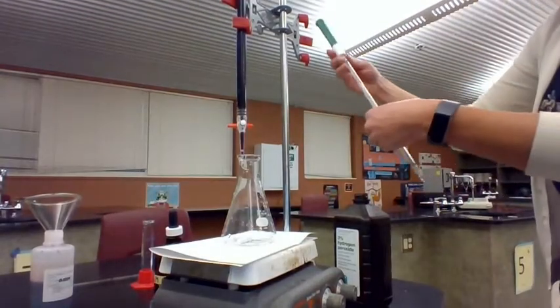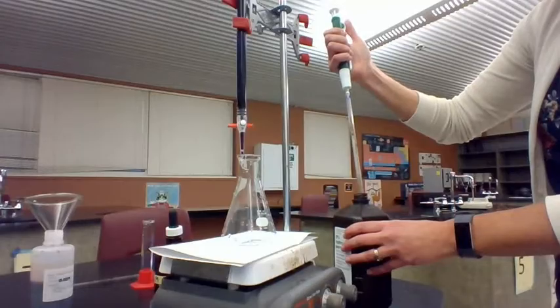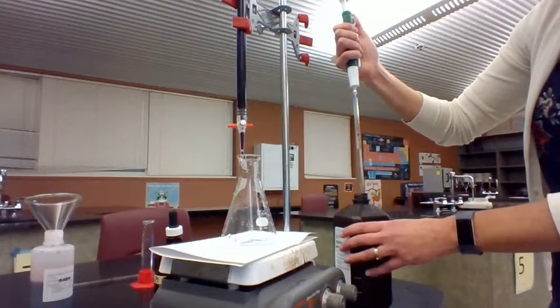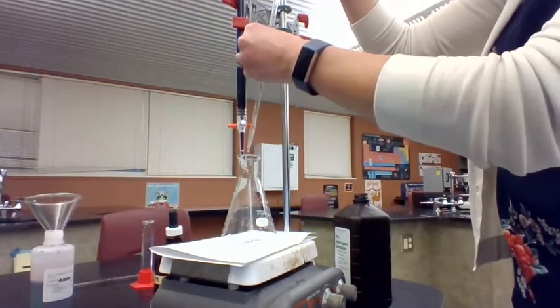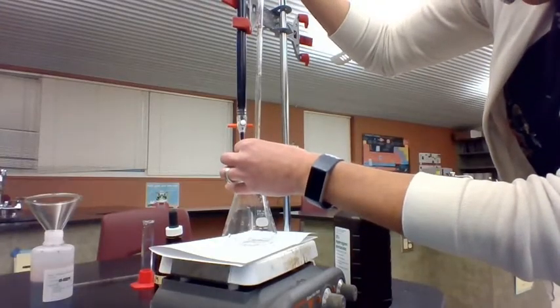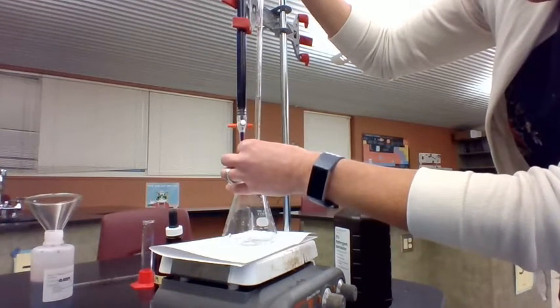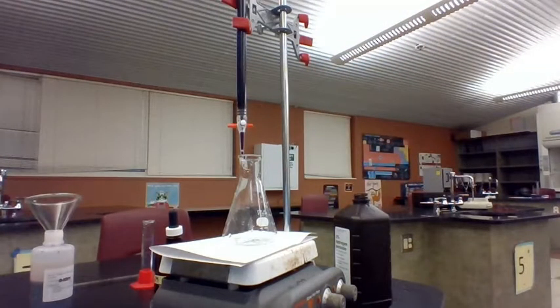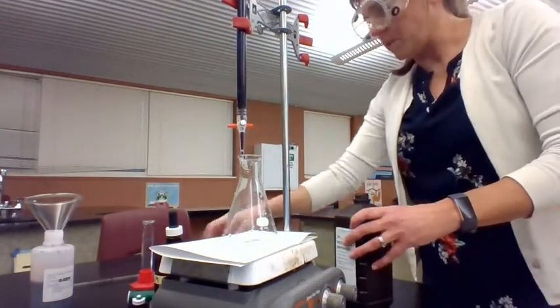What we're going to do next is measure out a precise volume of our unknown solution. I'm going to use a volumetric pipette. I fill the liquid up to the mark zero here, and then I'm going to empty this into my flask until it reaches 2.0 milliliters. So I have added exactly 2.00 milliliters — I'm accurate to the hundredths place with this. So 2.00 milliliters of hydrogen peroxide.